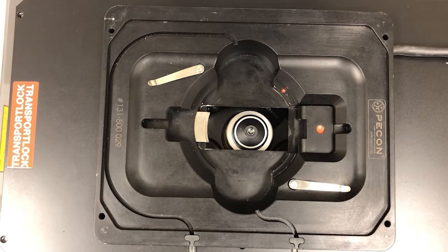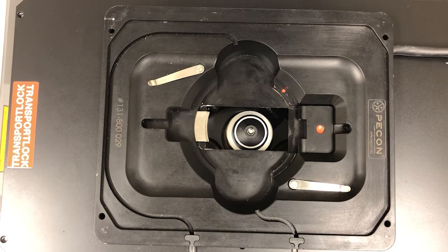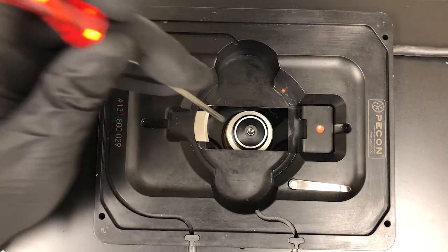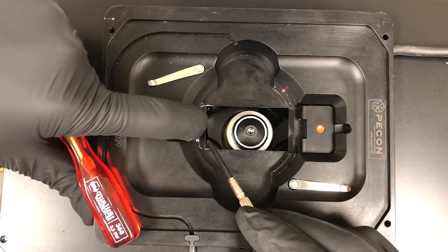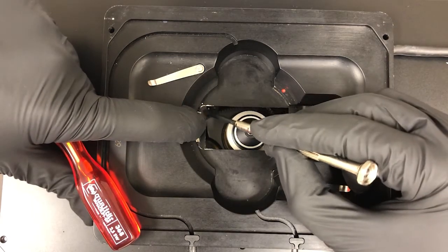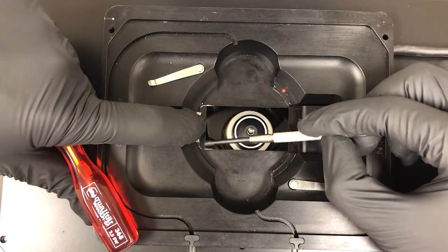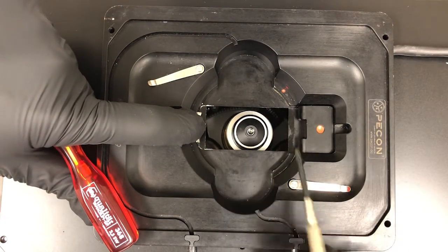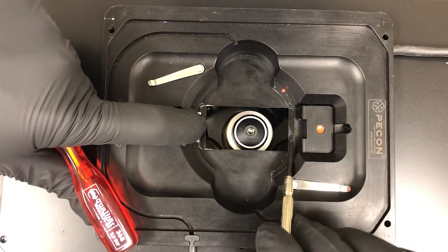Now, make sure that that bigger dish has a cover slip bottom, because else you won't be able to use most of the objectives on this microscope. If you're using a Nunc, so this chambered cover glass, you need to insert it. Let me see if I can find something to point here. So you need to push this back, typically with your finger. So actually, let me do it with my finger. And then you will need to place the Nunc on here and on here. And note that between this part and this part, this edge is actually an edge. So you need to make sure that you place the chambered cover glass here and here, but not on the edge, because if you do, it'll be tilted. In fact, you can actually stress the glass and you can break it. So make sure that you insert it here and there, okay?